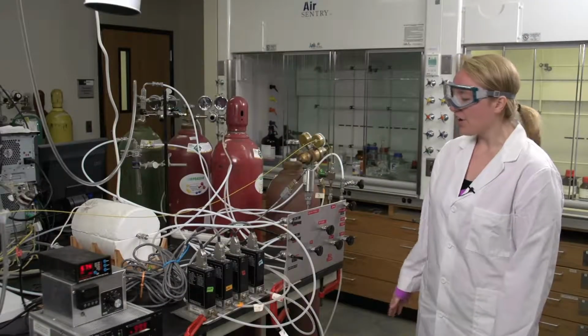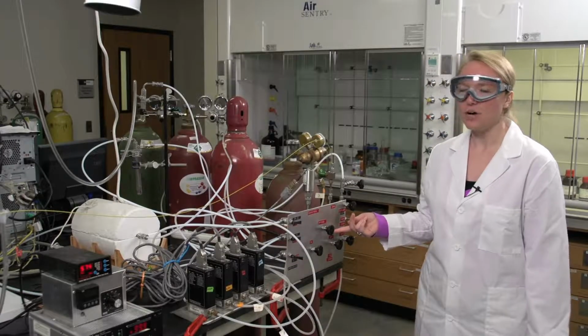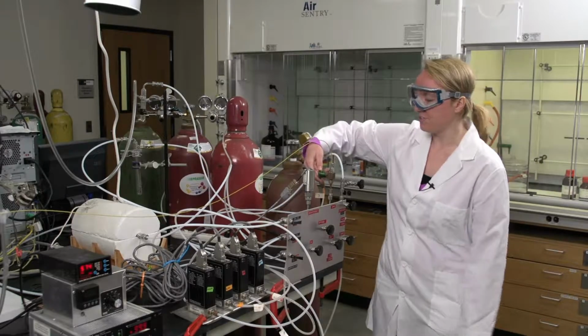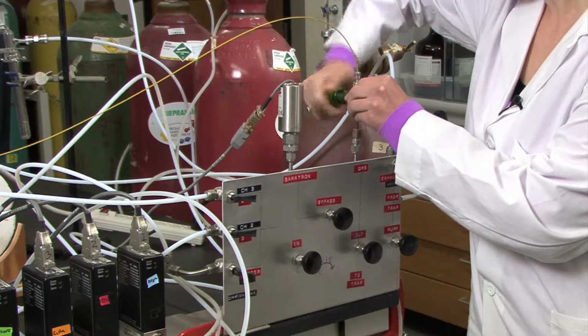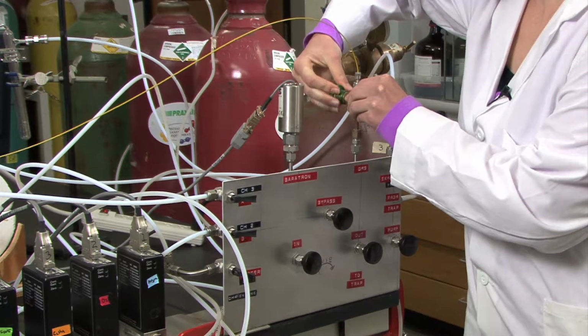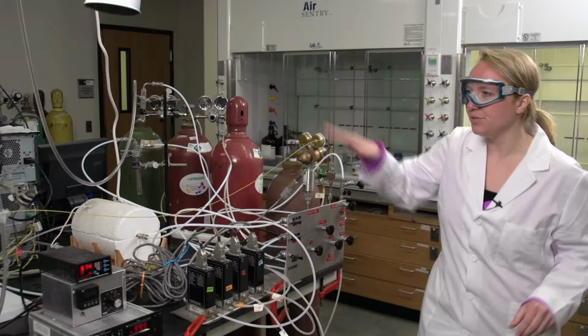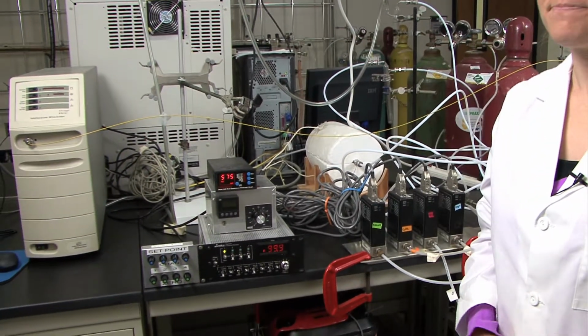So now we've got our argon flowing through the channel 1 and then in through the bypass, and then we want it to go into the mass spec. So we need to turn on the valve to the QMS, which is this green capillary valve. So turn that on. And then that will lead to the mass spec. Make sure that the argon is flowing to the mass spec before you turn it on.